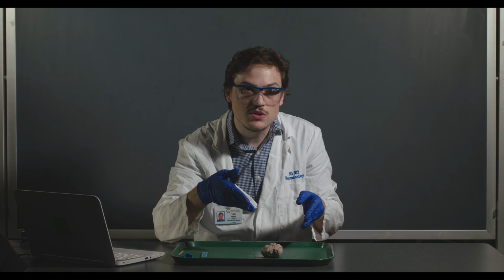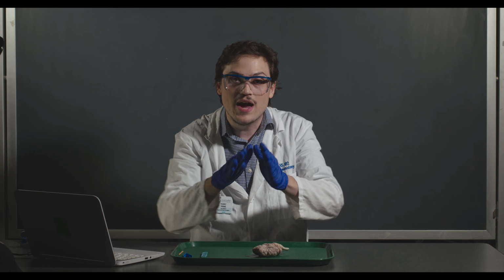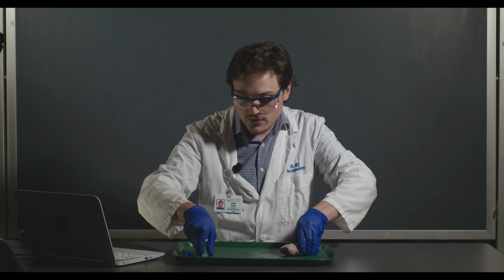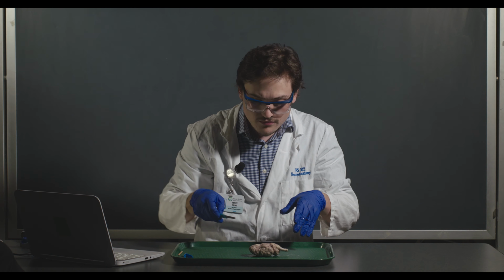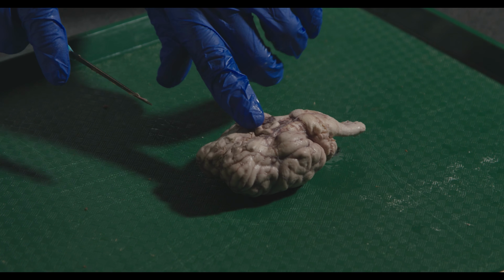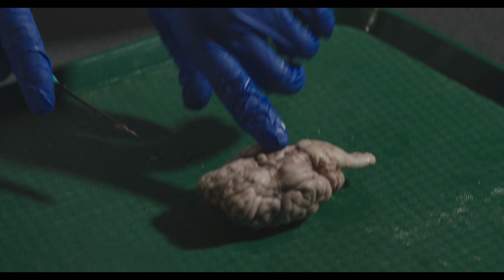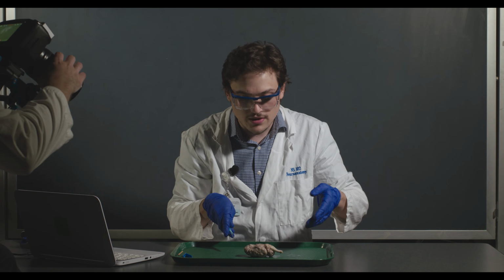I'm going to try and do some of these coronal cuts here with a full sheep brain so that we can see both halves actually laid out here on the slab. The lab manual shows about the regions where you want to cut. There are red dashed lines that show it. So you'll want to try and do one around the corpus callosum, one around the chiasm, usually one around the mammillary bodies, maybe a little bit posterior to it, and then definitely one through essentially the colliculi.